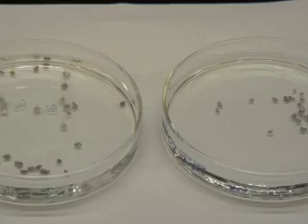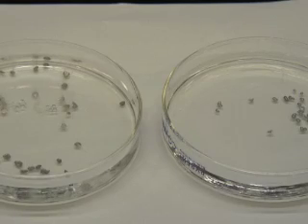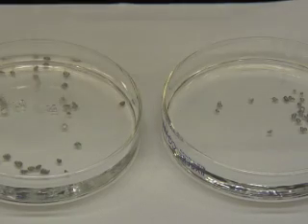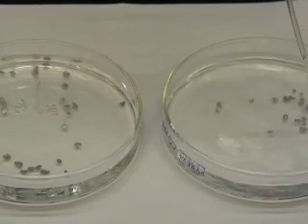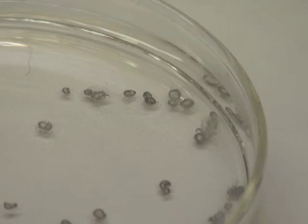We can see that the magnesium does react and a gas is produced, but the aluminum still does not react. Let's see if the addition of more acid will result in a reaction. With enough acid, aluminum does react.